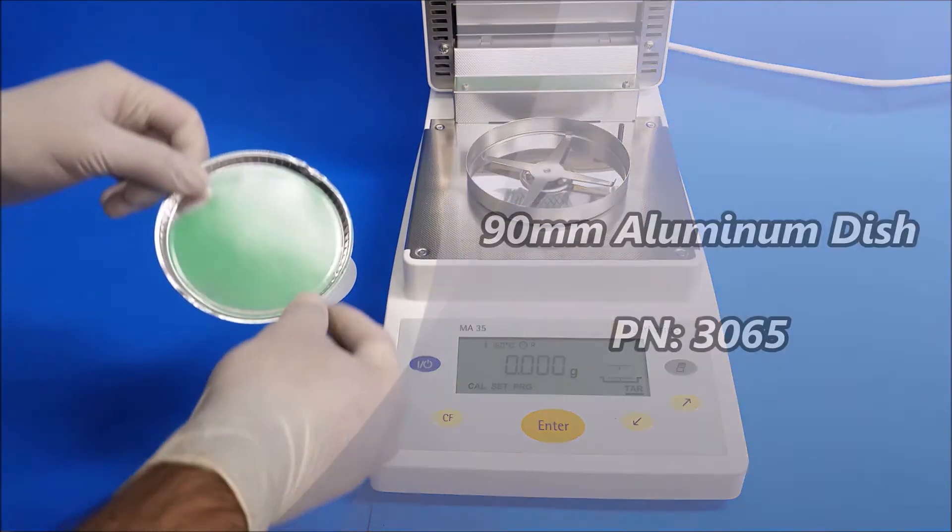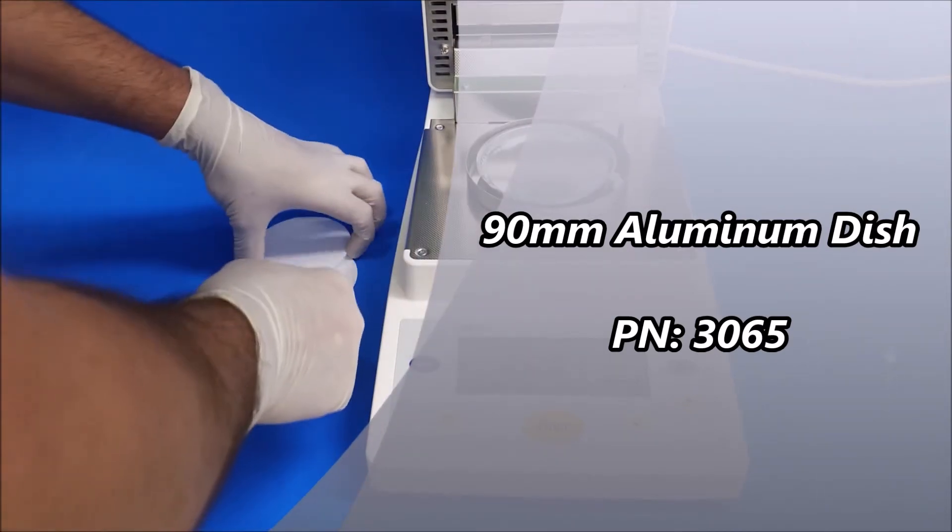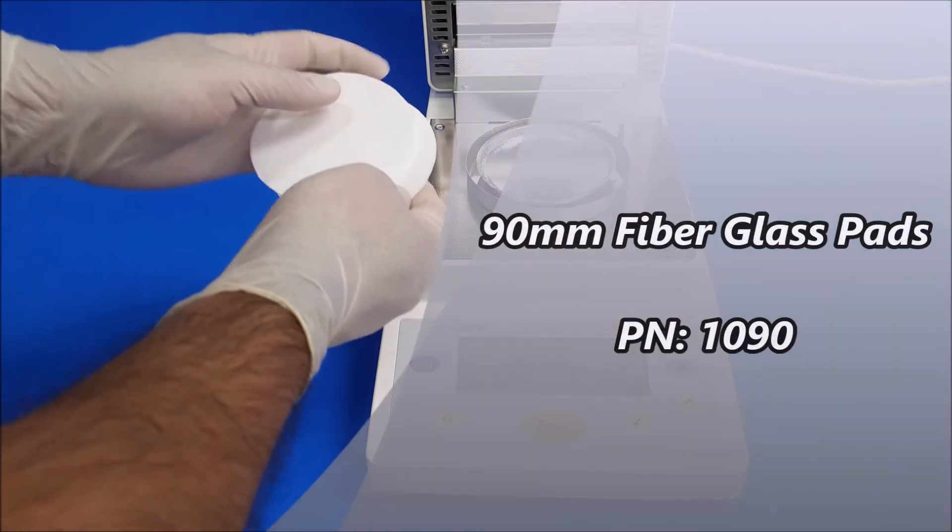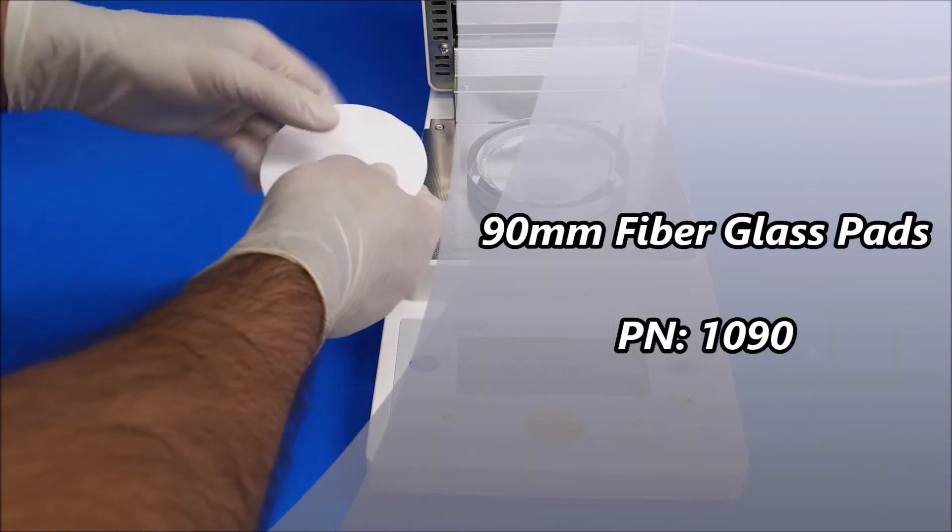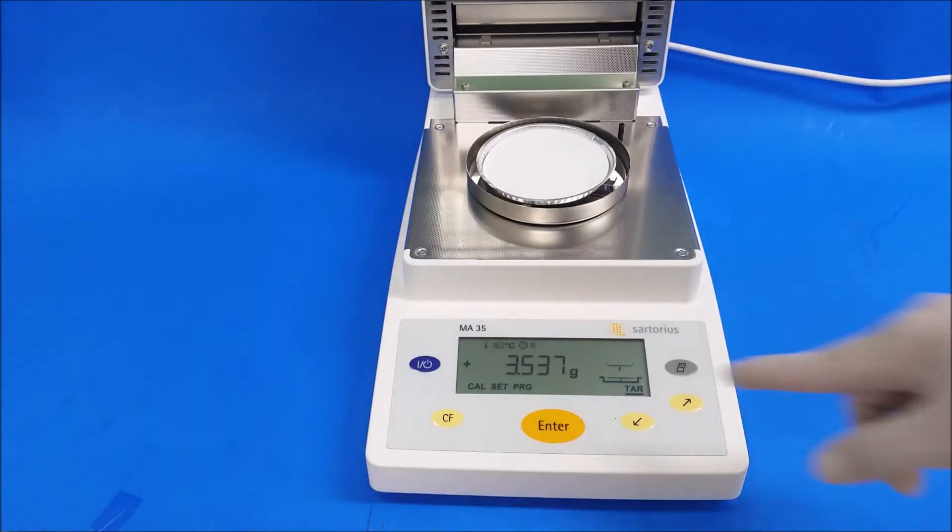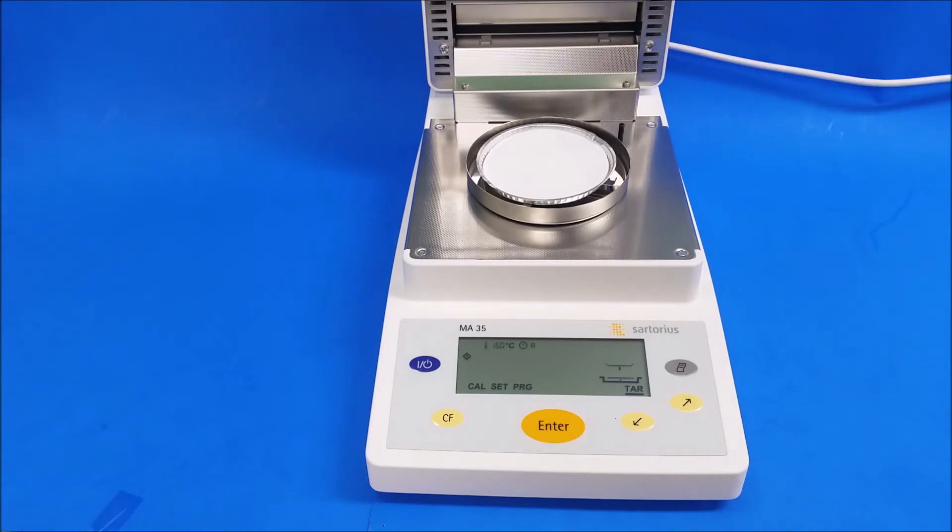Now you want to press enter to tare. Just remember to be highlighting tare. That's asking for the sample.